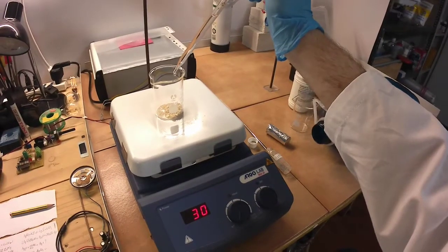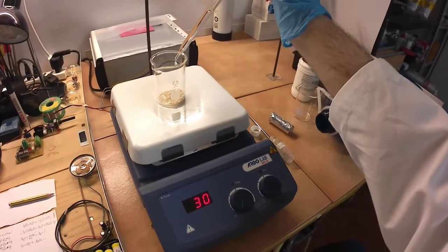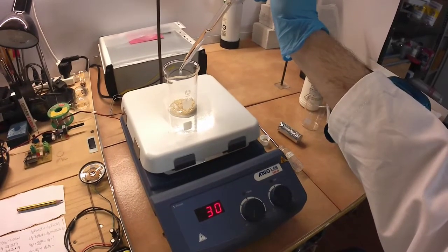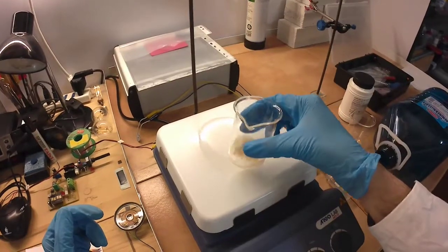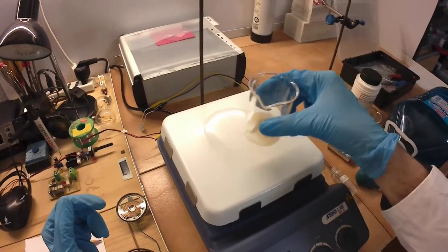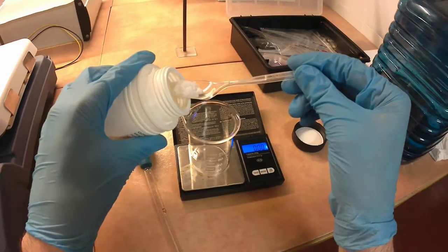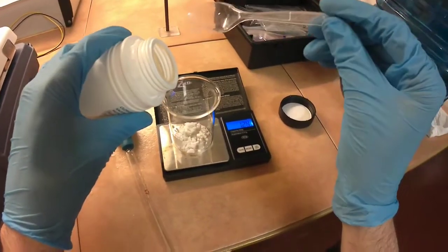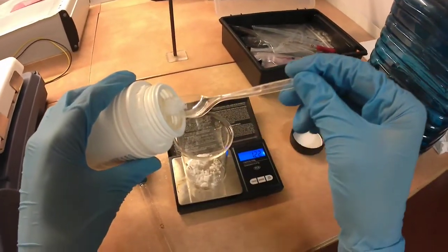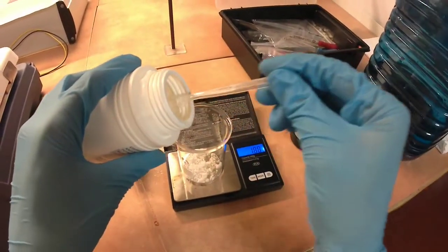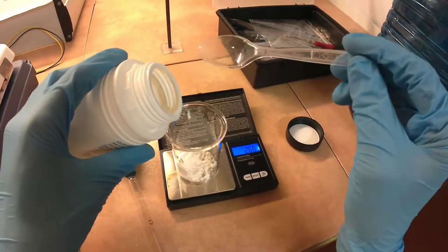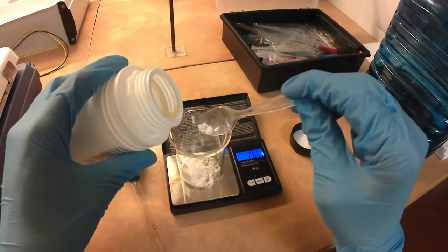Let's begin with the first step of the reaction. First, let's dissolve the silver nitrate in water. I pre-weighed it, and we are working with 4.7 grams. While the silver nitrate is dissolving, we can prepare the potassium chloride solution. We could have used sodium chloride just as well, but I happen to have analytical grade potassium chloride, which won't introduce more unwanted impurities.